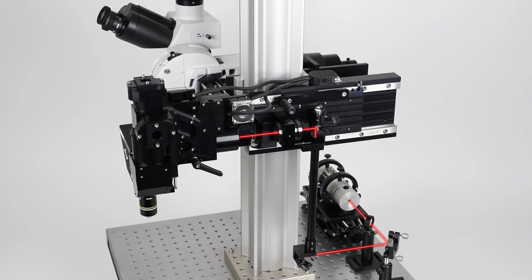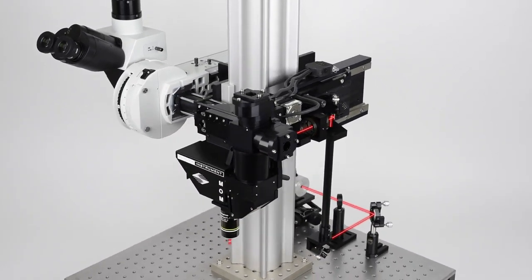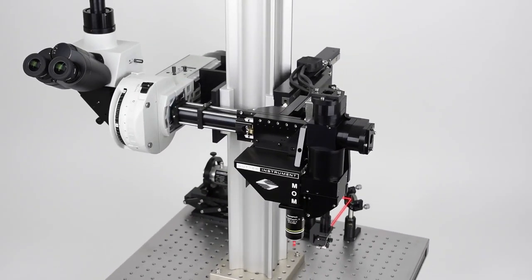Our 3-photon movable objective microscope also uses the same main imaging beam path, but with a custom scan lens and tube lens for transmitting the longer wavelengths. Then, the moving head of the microscope positions the beam through the objective and onto the sample.